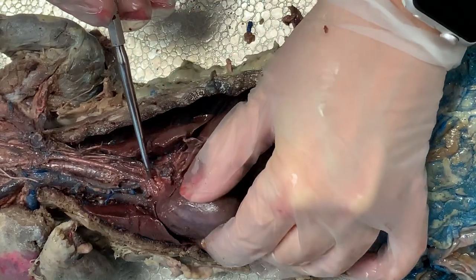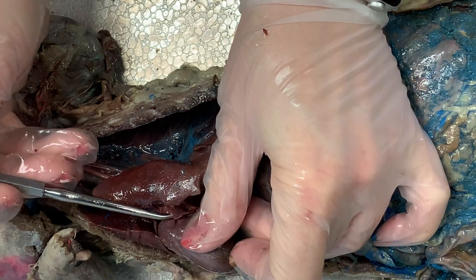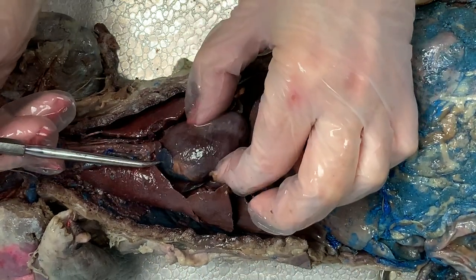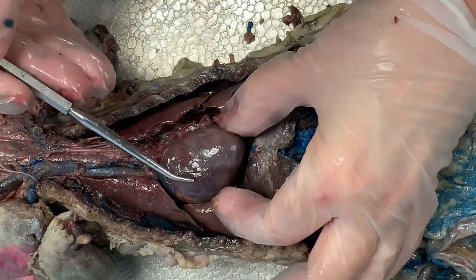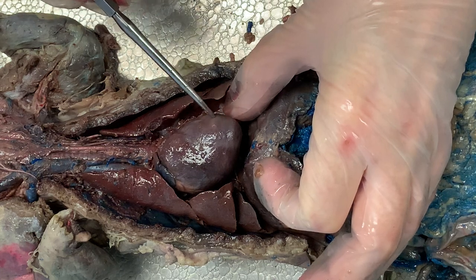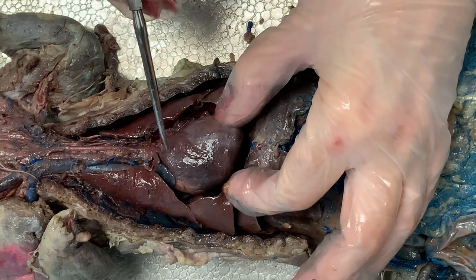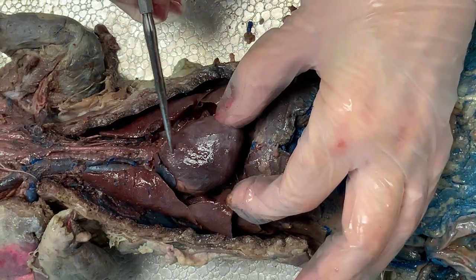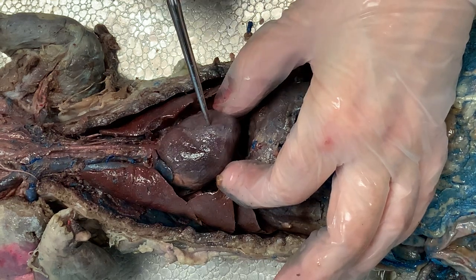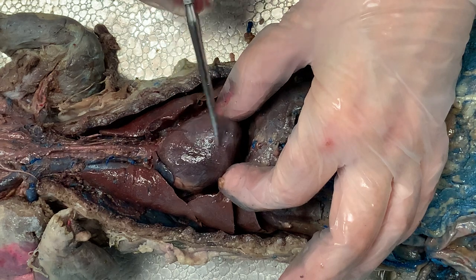If I roll the heart to the left, it's a little harder to see because it's more posterior, but right there — I'm wiggling it — that is the left auricle. Rolling the heart back over, the right auricle is this pouch. The ventricles are the lower chambers. This would be the right ventricle, right below the right auricle. Where the apex — the tip of the heart — is, that would be the left ventricle. Sometimes you can see a separation by the coronary artery, though in this mink it's not very visible. There is a bit of a color change, but you can't really go by that as each heart looks different. Usually there is a little groove, a sulcus, running through there where the coronary artery would be visible.